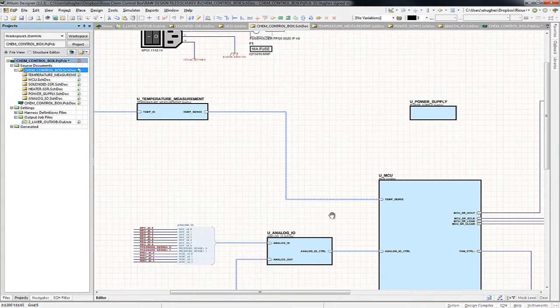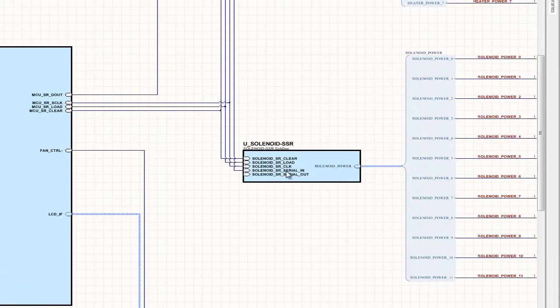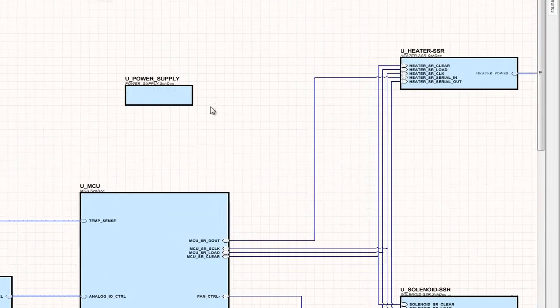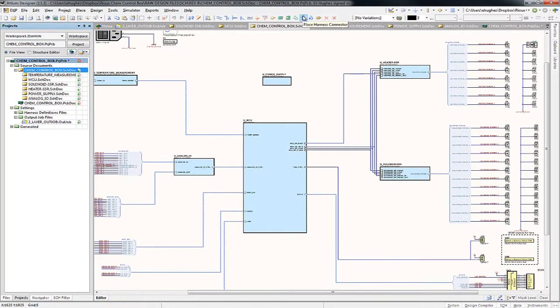So there's one in the middle called UMCU for microcontroller. This shows all of the I/O coming out of the microcontroller page. There's one for the analog input output, the solenoid digital I/O, the heater I/O, one representing the power supply. And they're just blocks that represent the instances of these other schematic sheets. Now, we're just going to take a quick look at what's in these different blocks.